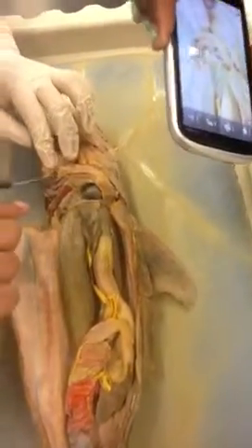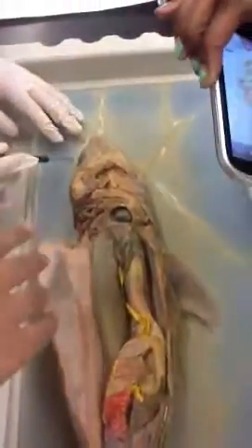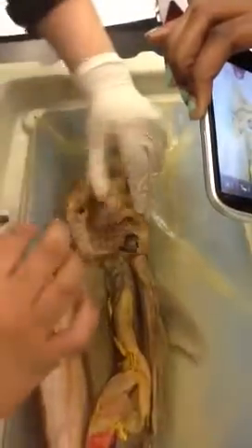This is three, right? Yeah, it depends on which side, I guess. Yeah, it's annoying. I honestly think you could argue. You open it up. I don't think he'll pin it because he has a model, but it's an option.